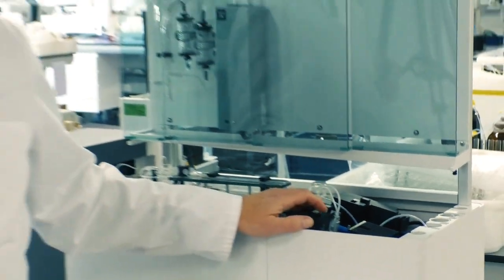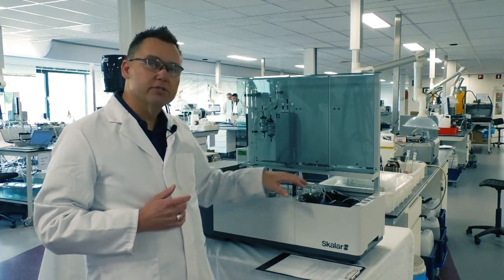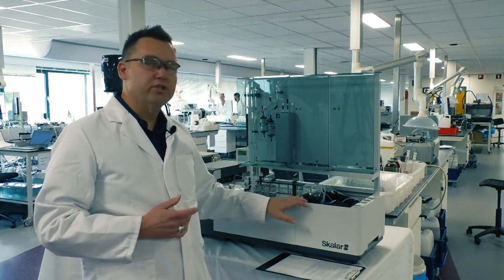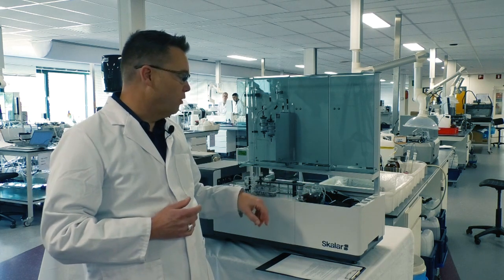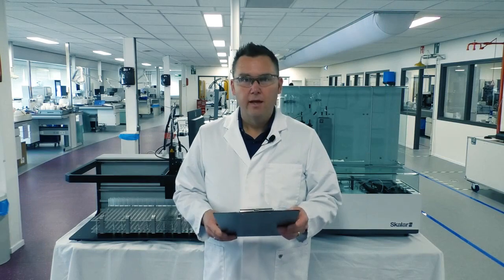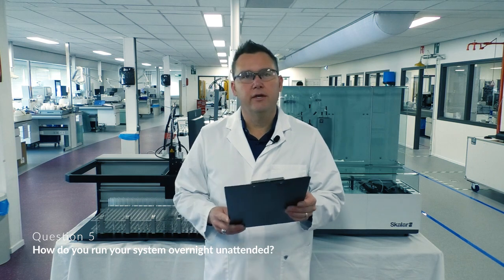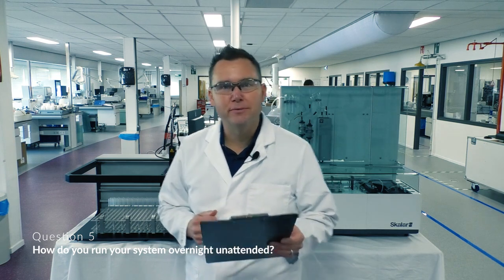So there's no special alignment that's needed for changing your flow cells out. They can fit on either side. The main part is to just understand in your software where the flow cell is oriented, and your correct wavelength, and away you go. And now on to our fifth and final question. How do you run your system overnight unattended? Well, that's easy, and I'll show you.